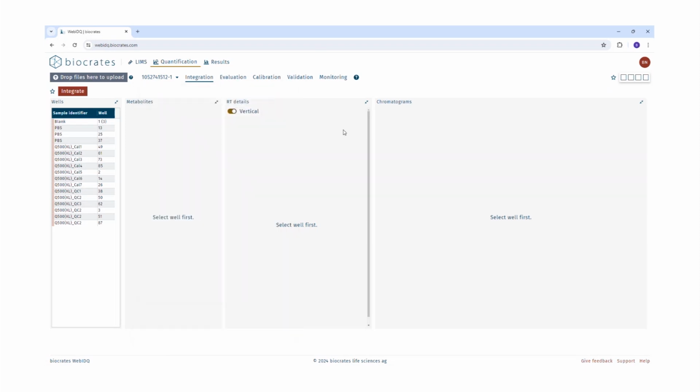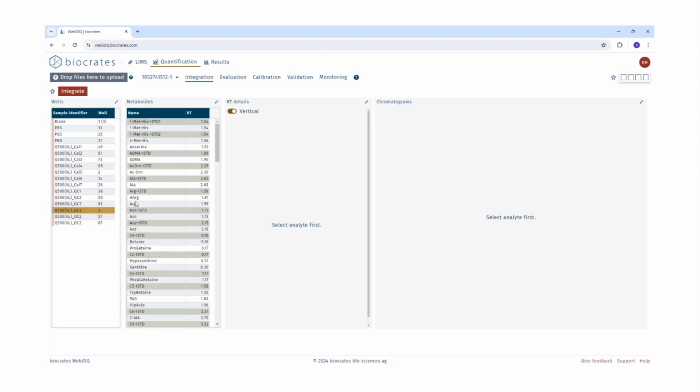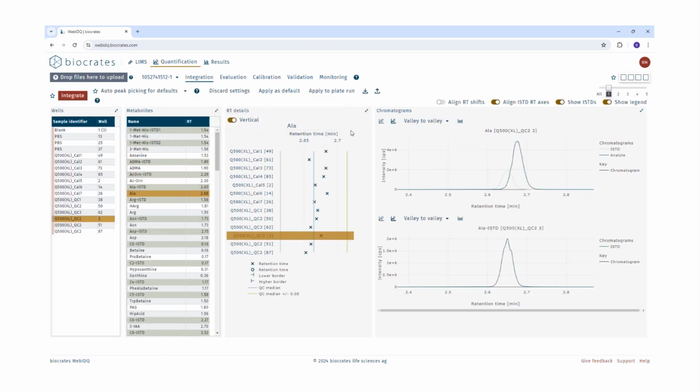After loading the LC data, the first step is to define the integration windows for each metabolite. WebIDQ contains a tool to automatically determine the retention time of each metabolite. To access this tool, select a sample from the wells list. For example, here I have selected Quality Control Level 2, and then a metabolite from the metabolites list. For example, here I'm selecting alanine. And now we can see we have two options for auto peak picking: auto peak picking for defaults and just auto peak picking.